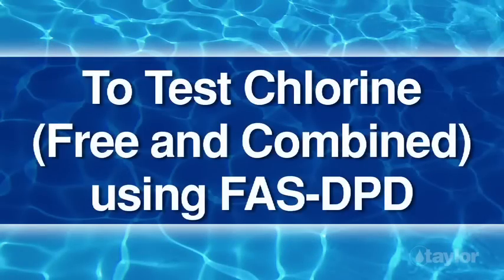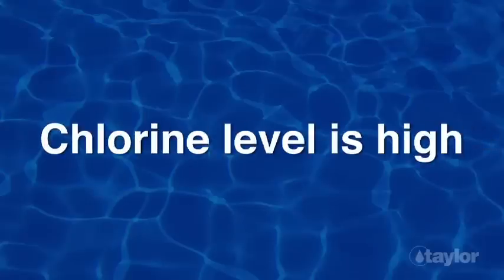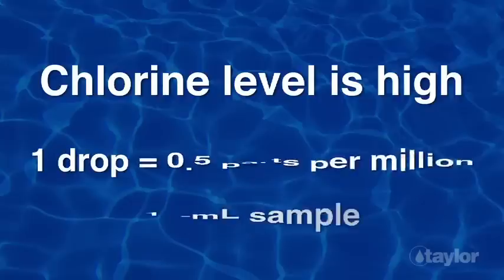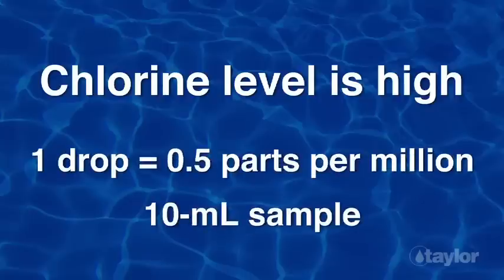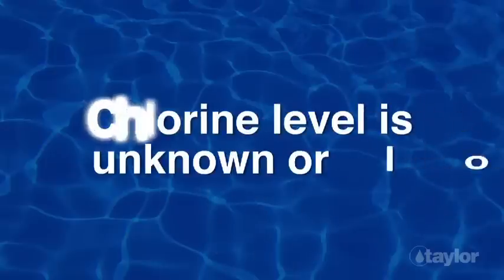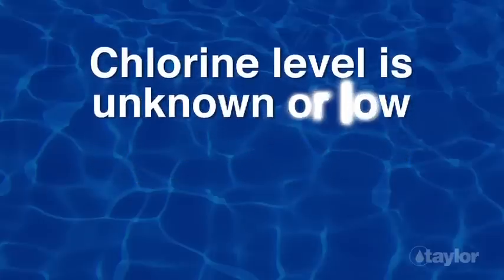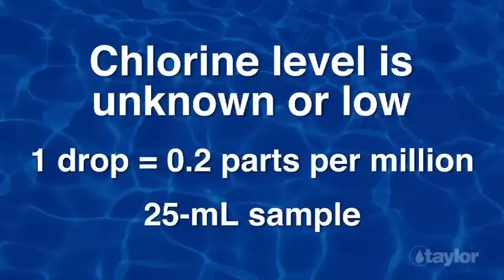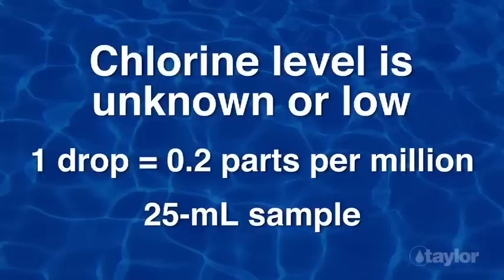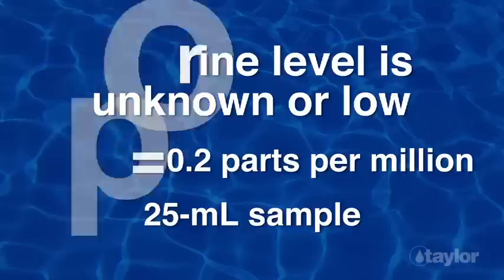To test free and combined chlorine using FAS-DPD, first decide which drop equivalents to use. If you suspect the chlorine level is high, perhaps because the water has been shocked recently, use one drop equal to 0.5 parts per million and a 10 ml sample — this will save time and titrating reagent. If you do not know the chlorine level or suspect it is low, use one drop equal to 0.2 parts per million and a 25 ml sample. This demonstration assumes the chlorine level is unknown.